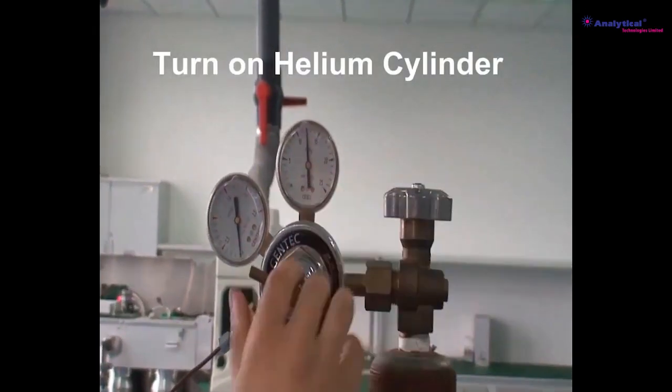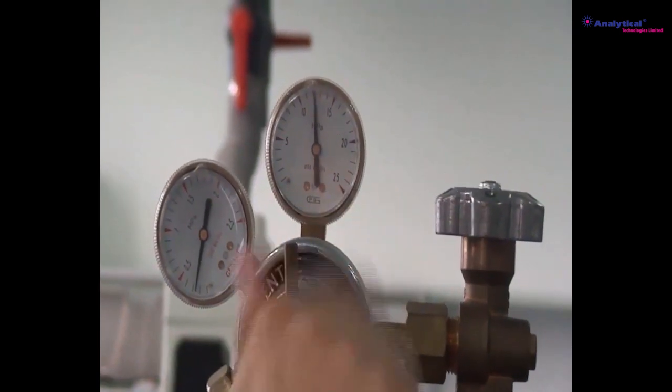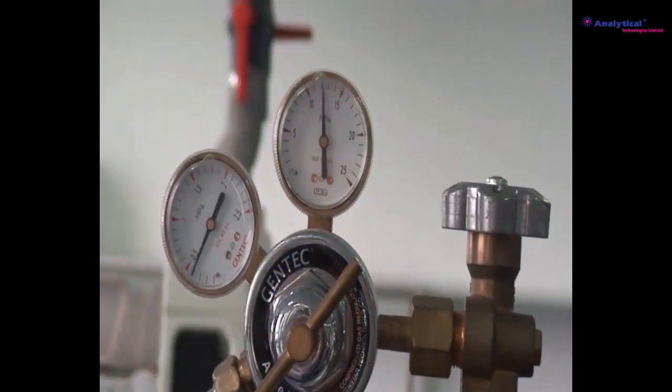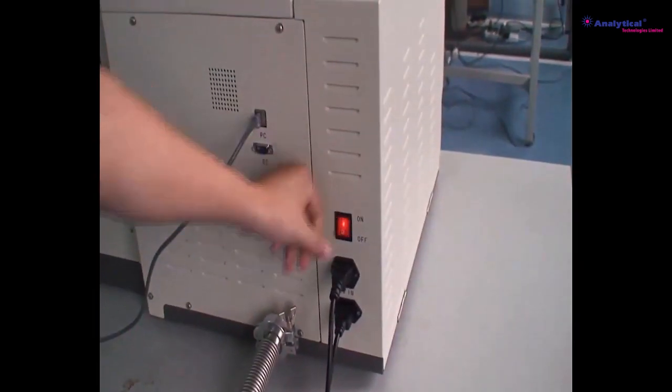Open the valve of the helium cylinder, ensuring the high-pressure gauge is more than 3 MPa. Switch auxiliary valve. Adjust output pressure to around 0.4 MPa. Turn on gas chromatograph. Turn on mass spectrometer.